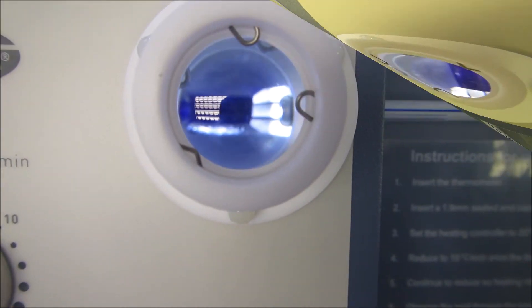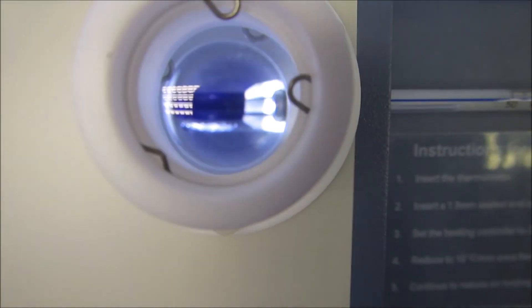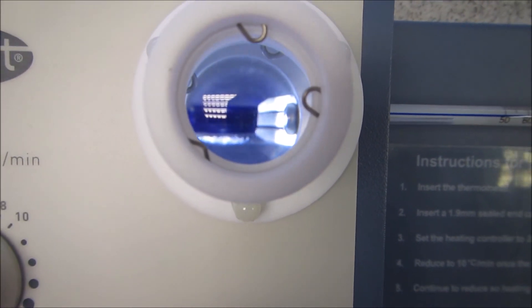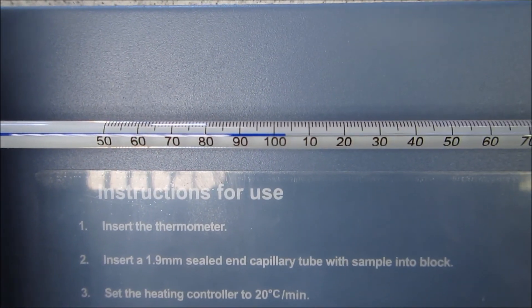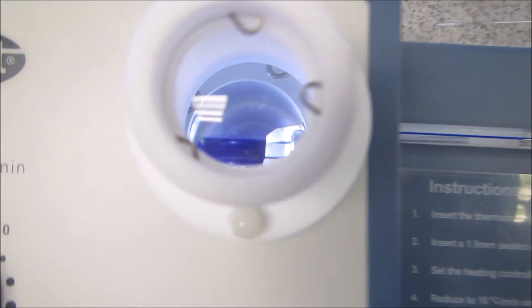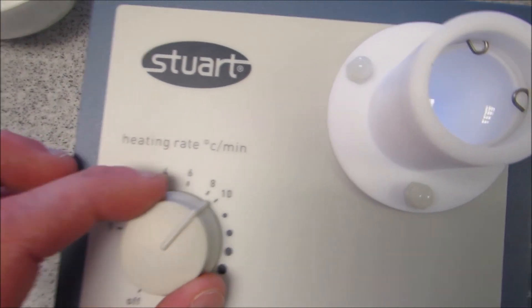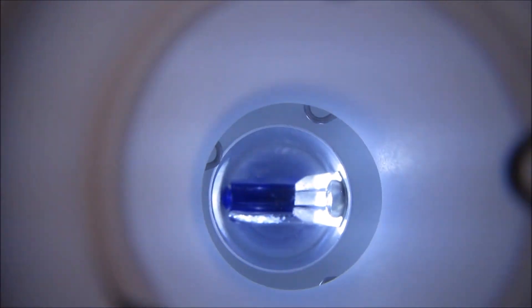So it's a good idea to find out what the rough melting point of the substance you're testing is beforehand. I've let the temperature raise very quick and it's now around 100 degrees. And I think it's around the 110 mark. So I'm going to turn down the heat because I don't want to miss the end point.